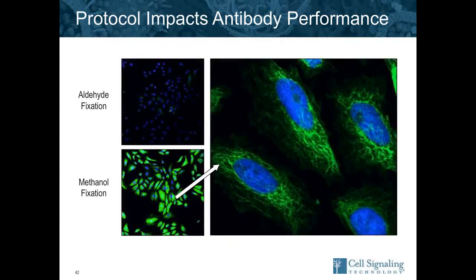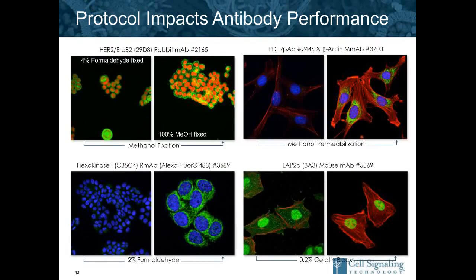This is another example of fixation. Cross-linking fixatives like formaldehyde and glutaraldehyde are very good for most antibodies, but some, notably the keratin antibodies, do not work well. They actually do better in a precipitating fix like methanol, shown here. So you can see the stain is still absolutely correct and looks good in the methanol.